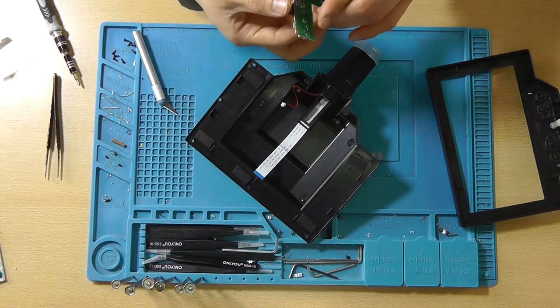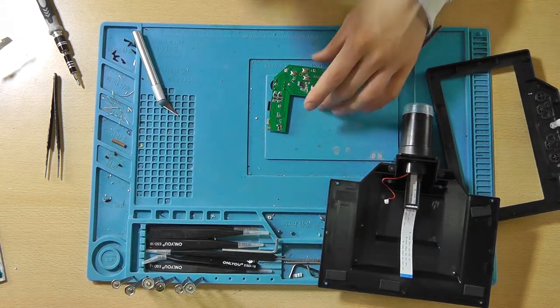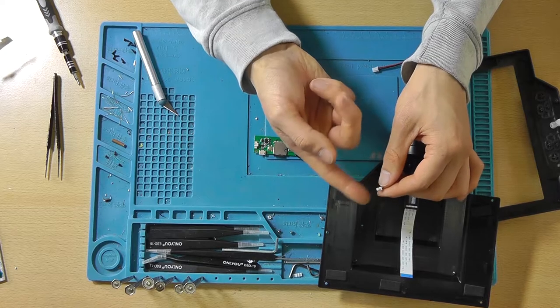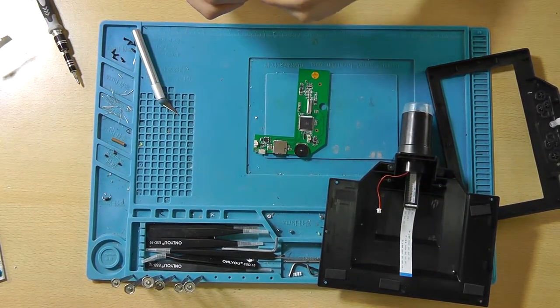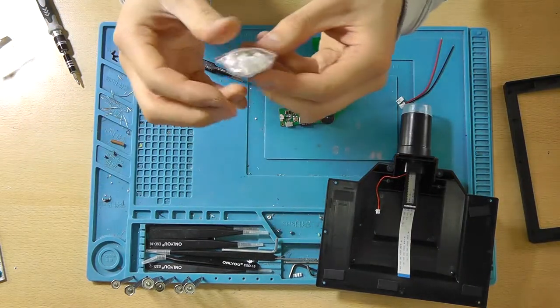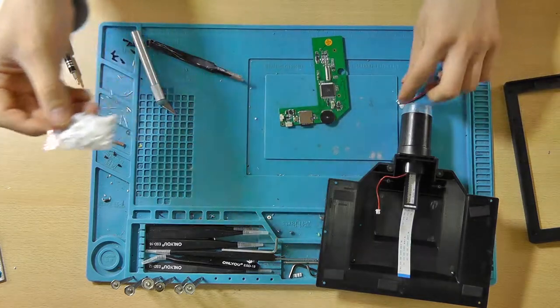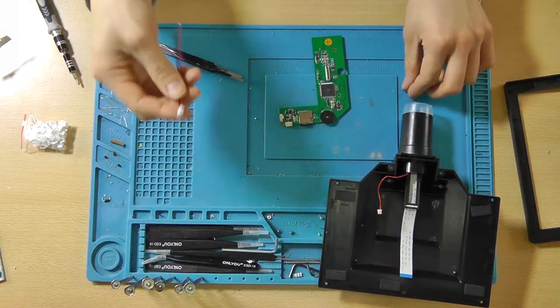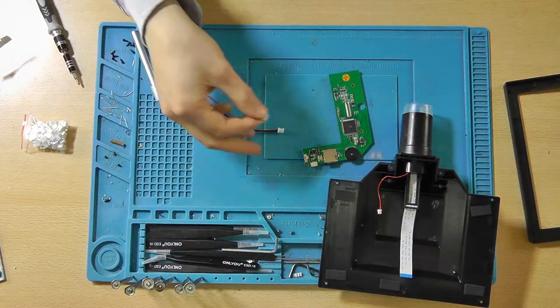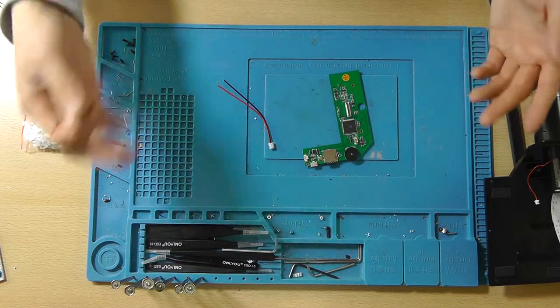Now there is a thing that we could also do. We could also just remove these wires from the connectors and just put them onto the board, but let me go have a look if I can find one of these tiny little connectors. So unfortunately I was not able to find a small connector like this. I did find a little bag with connectors that I can use to actually connect this wire to. So if I remove this connector from the PCB and I solder this connector on here, we can actually just reuse this wire. Well, reuse, we can actually just use that wire.